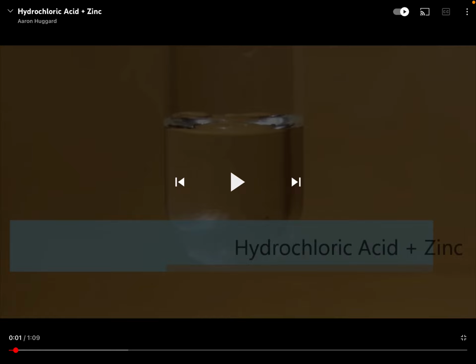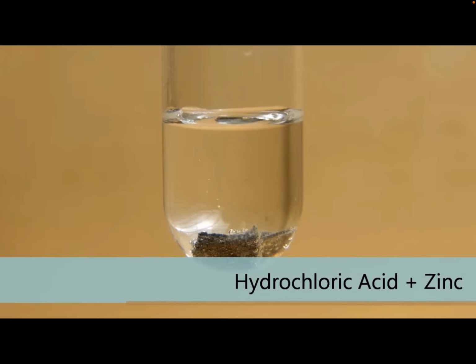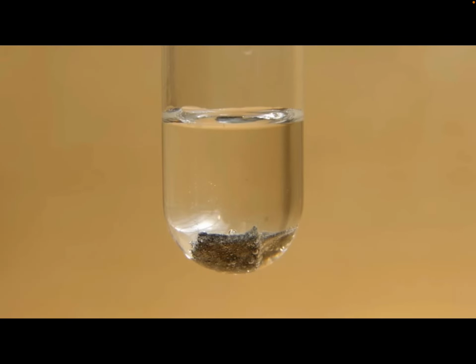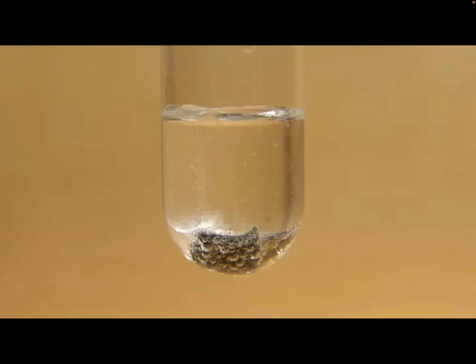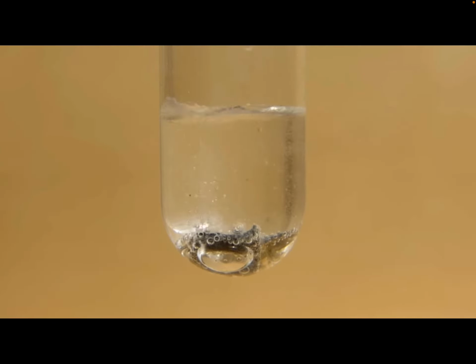Hi everyone! In this video we're going to go over the last type of reaction, reduction-oxidation reactions. In the reaction I'm about to show you, they're going to place zinc in a test tube of diluted hydrochloric acid. The hydrochloric acid has some water in it just to keep it safe, so it's not pure hydrochloric acid. But you might already notice that some bubbles are forming.